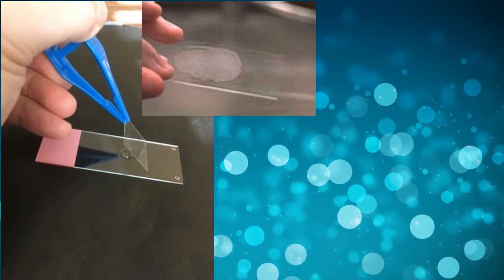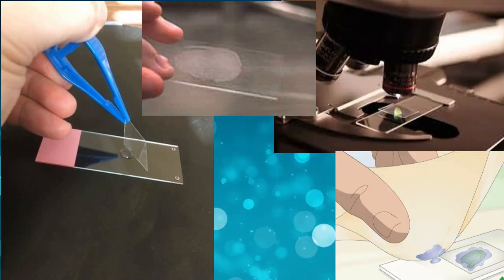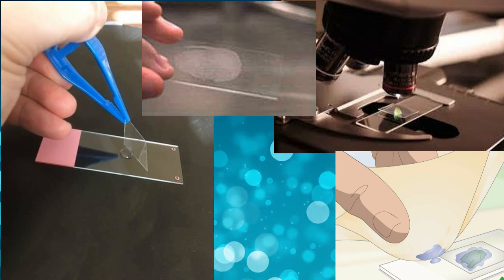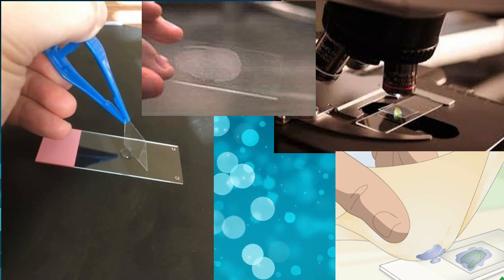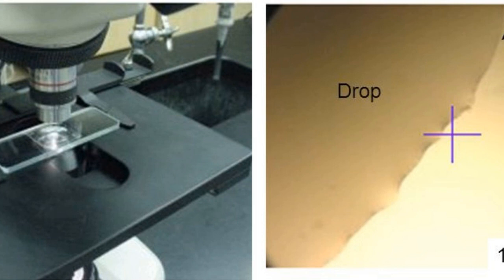Wet mount is easy to prepare, but the coverslip can damage larger cells, the slide can dry up quickly, and there is a risk of contamination of the equipment as well as the observer. The hanging drop preparation is better in these aspects.